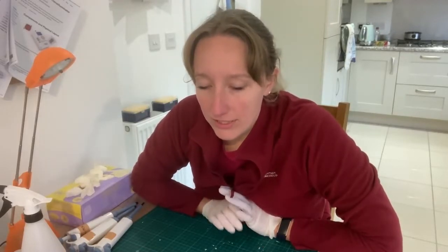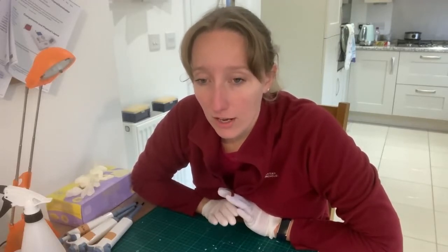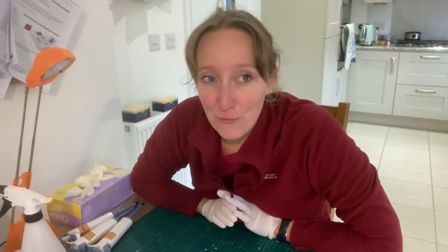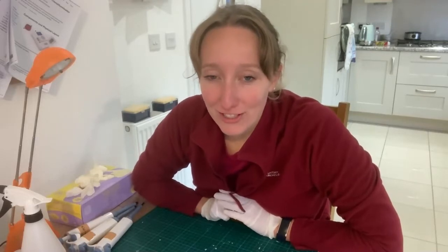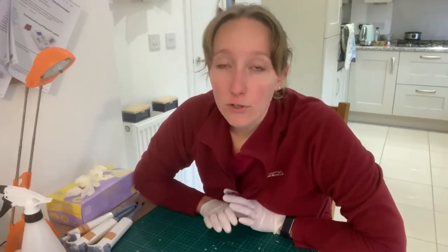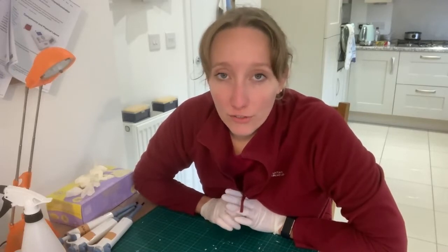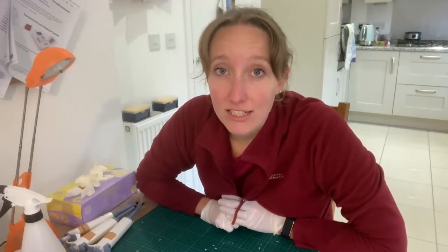At the moment the bird sexing workflow works well for a range of different birds, and I did get it to work for pigeons, but those were from feathers I'd plucked from a dead pigeon I found by the roadside on a bike ride. A potential customer has very kindly plucked some breast feathers from his pigeons of known male and female gender, and I'm now running the workflow on those to make sure it works well before he starts using it to sex his own birds.